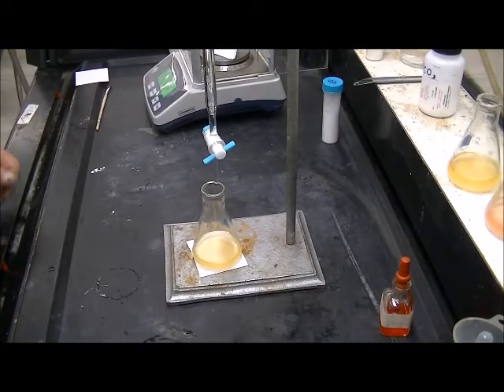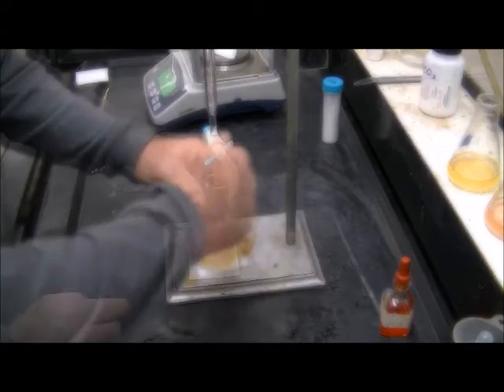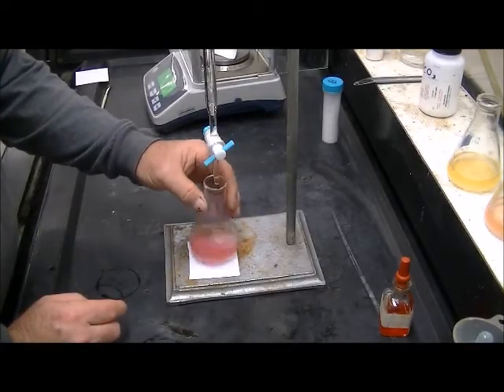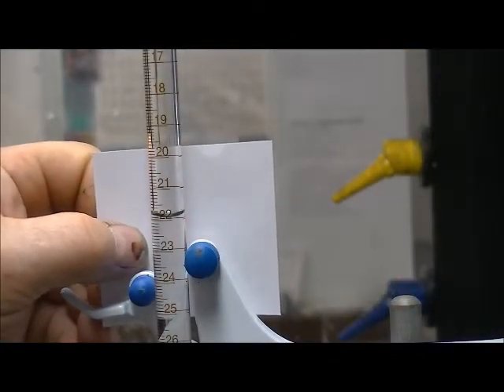And this is unknown B, sample 3. It looks like it was 21.9 milliliters.